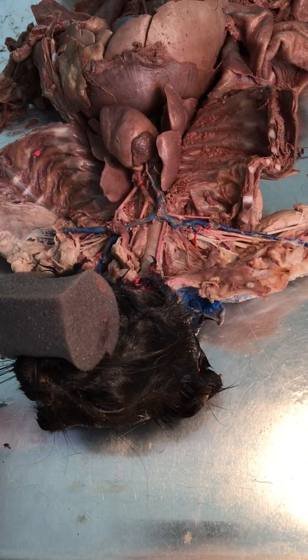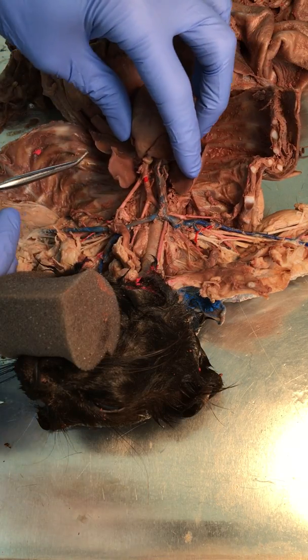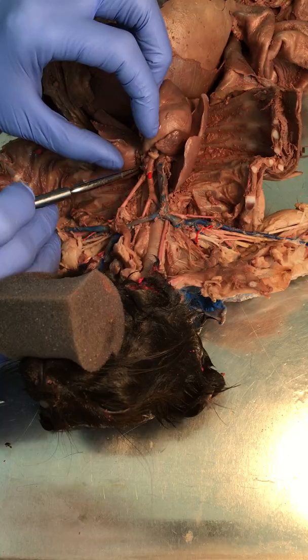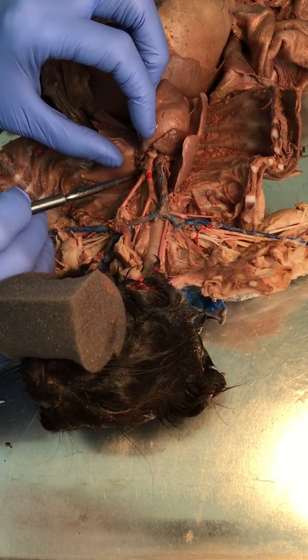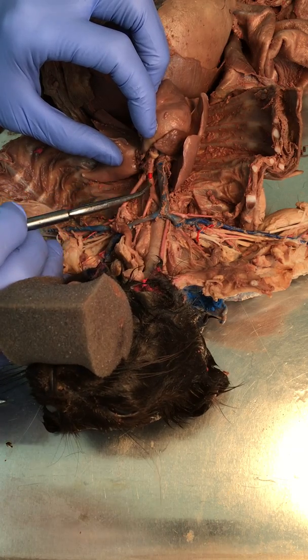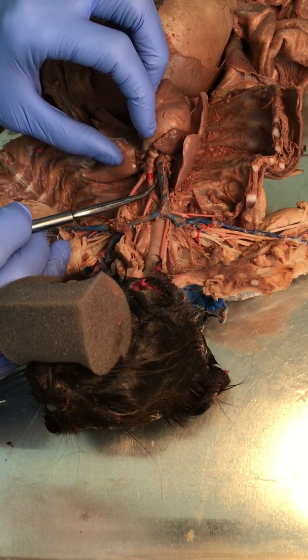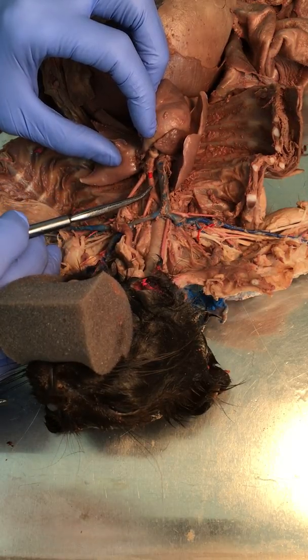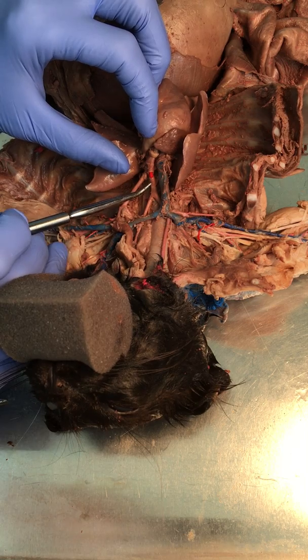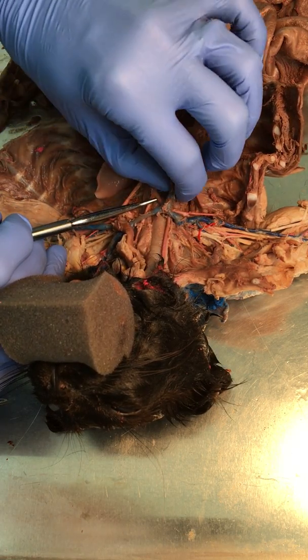and so we're going to begin with the thoracic arteries. So the first thing we're going to look at here is the arch of the aorta. Okay, so this structure right here. The first branch off of it is going to be the brachiocephalic trunk right here. Remember, brachiocephalic, it's going to the arm, brachio, and cephalic, head. And so that's going to come up. It is going to have several branches.